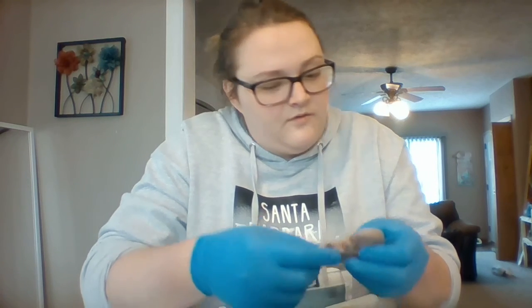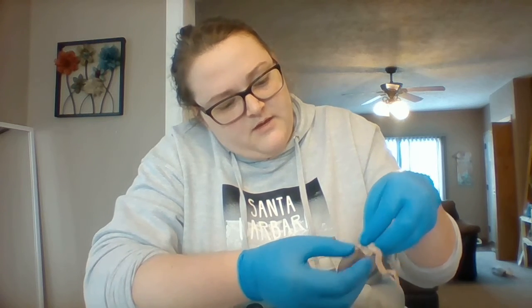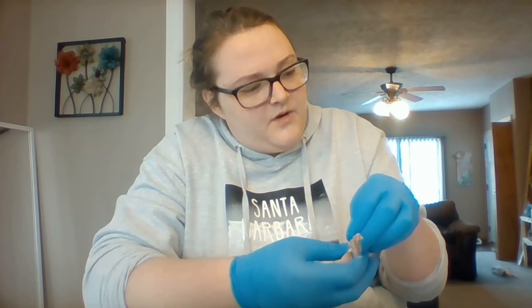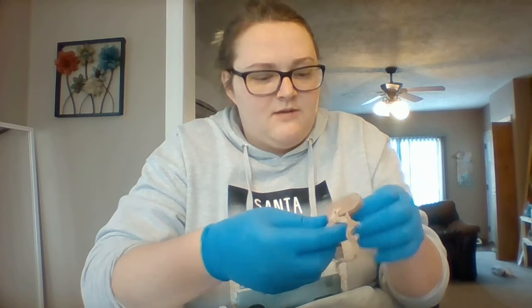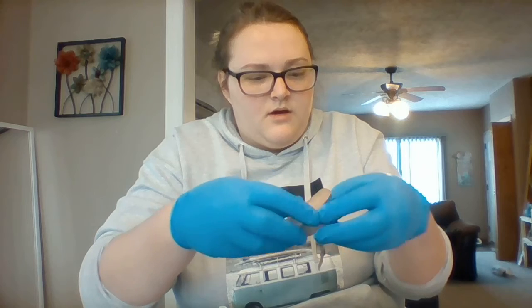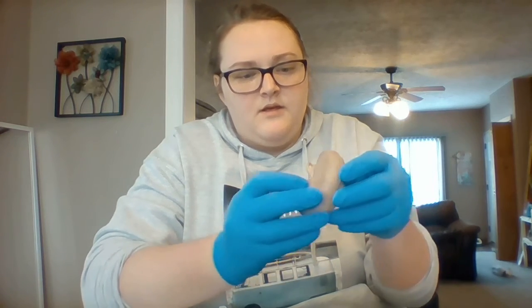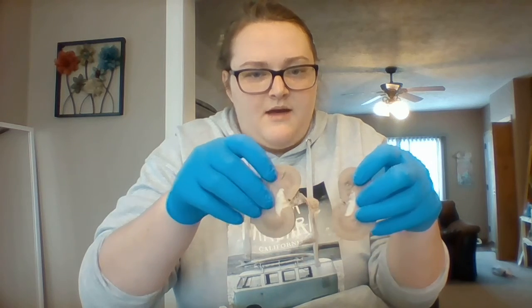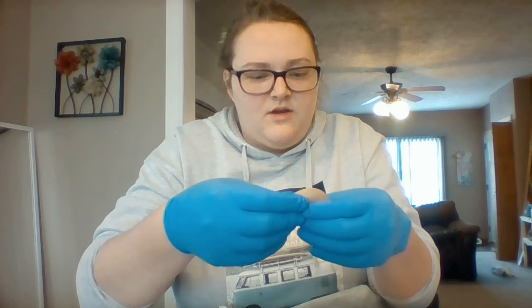And then we already went over the ureter and the renal vein that exit. And those are, of course, in that depression in the hilus. And that is the sheep kidney. So put together as one piece, it is like that. And those are the two halves that I worked with for my dissection and to determine the different parts of the anatomy. Thank you.